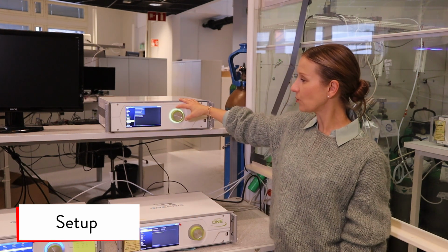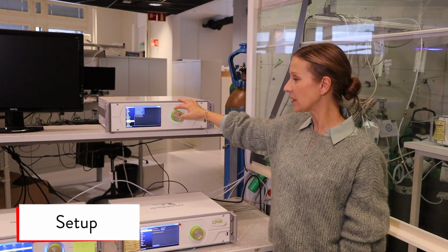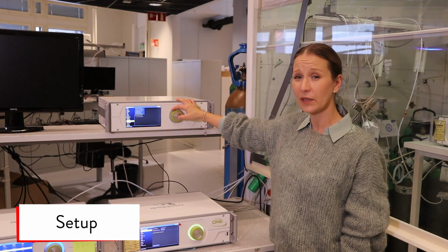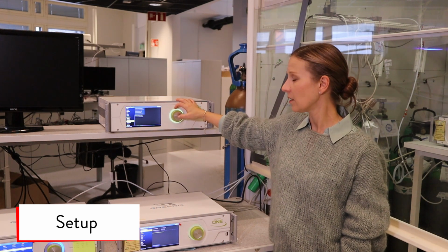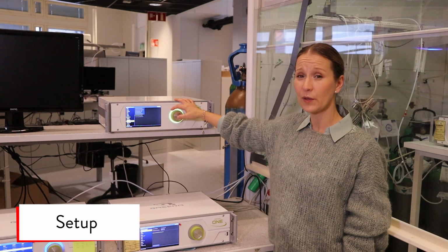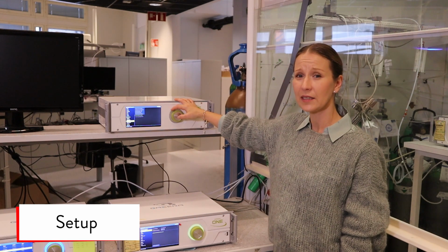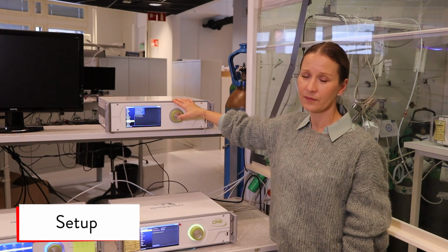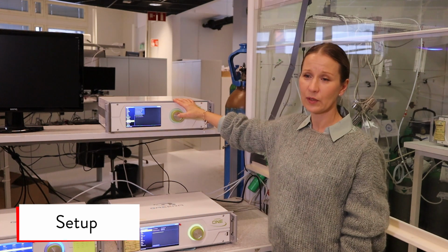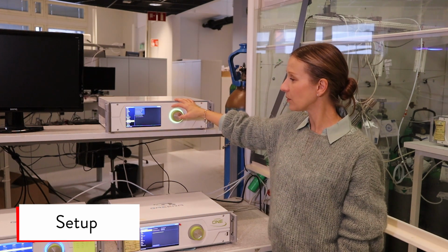From the support tools, there's the option to export service database. This is something that can be useful if there's an error or a problem with the device. Our support can help you the best if you send the measurement database and the debug logs. Usually, if the device is used with customer, the debug logs isn't enabled.